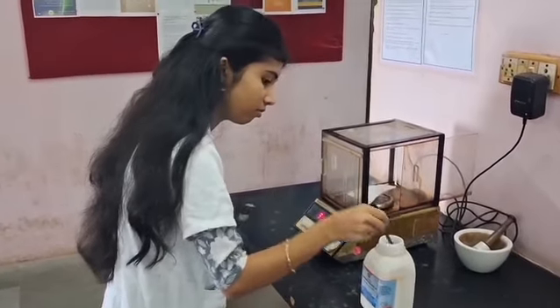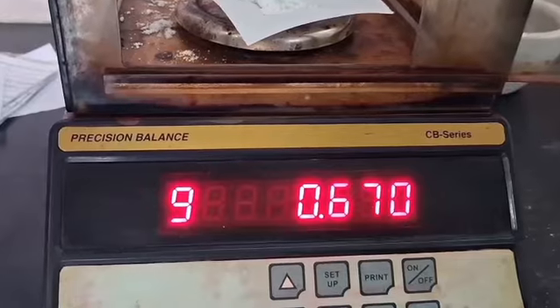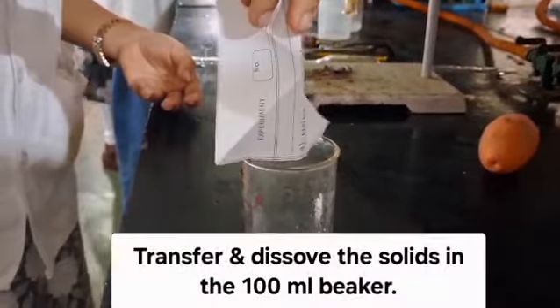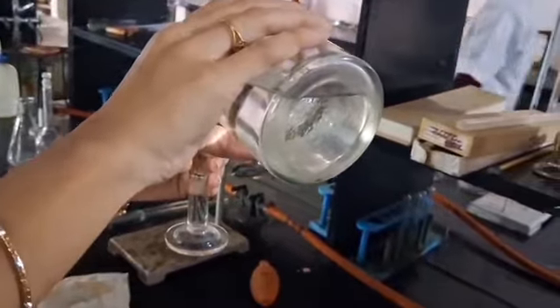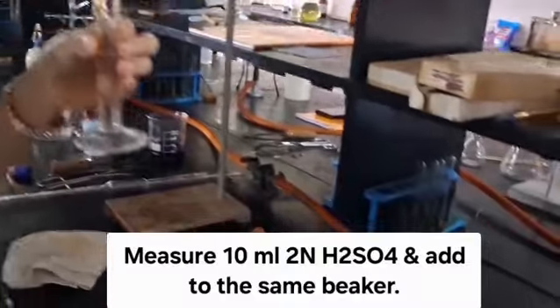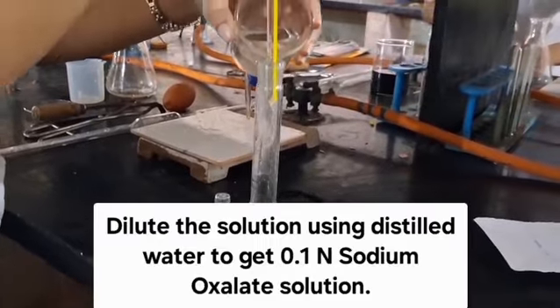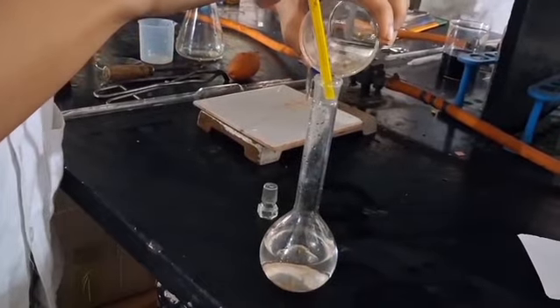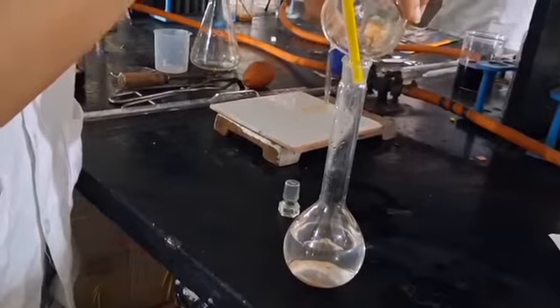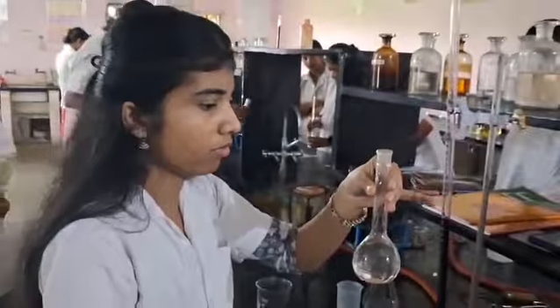To prepare sodium oxalate solution, weigh 0.67 g sodium oxalate. Transfer this quantity into a 100 ml beaker and dissolve in a minimum quantity of water. During the dissolution, measure 10 ml of 2 normal H2SO4 and add it into the clear solution. Transfer the clear solution into a 100 ml standard measuring flask. Wash the beaker and use that washing solution for the dilution of the solution. Dilute the solution up to the mark by using distilled water.